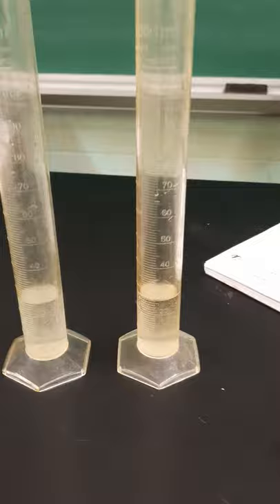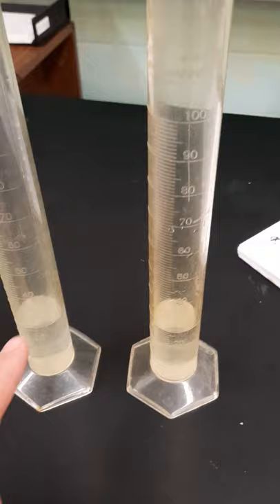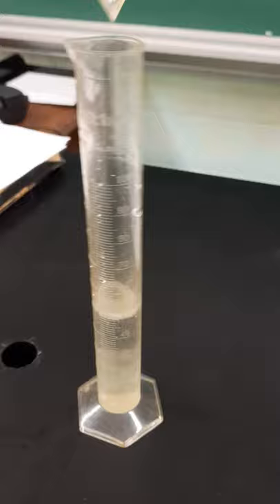So the question is: if we have 25 milliliters of water and 25 milliliters of water and we mix them together, how much water will there be? We're going to go ahead and do this — 25 and 25.